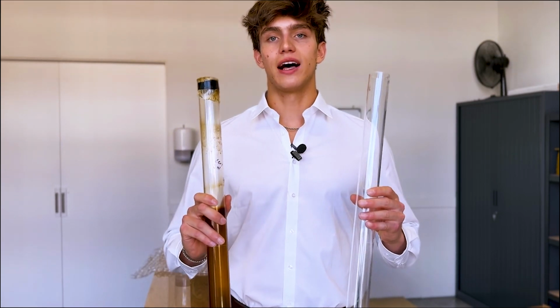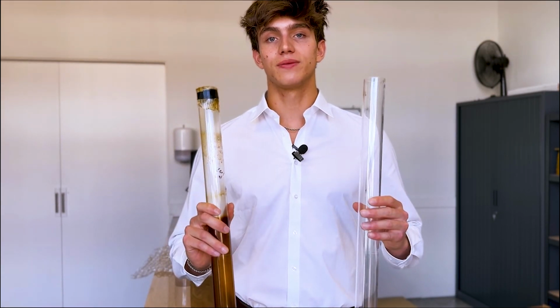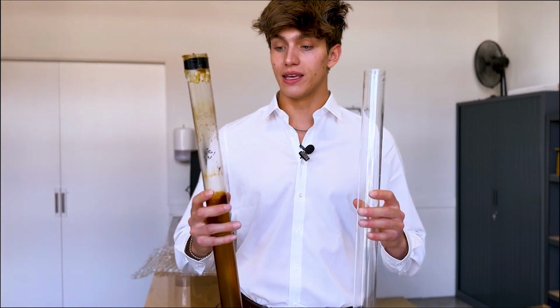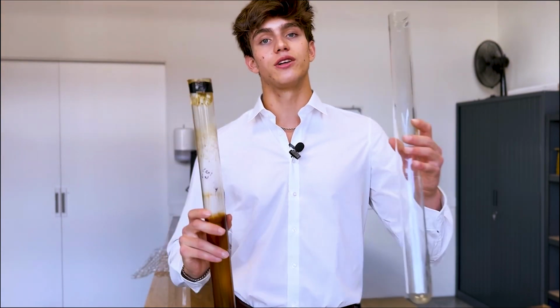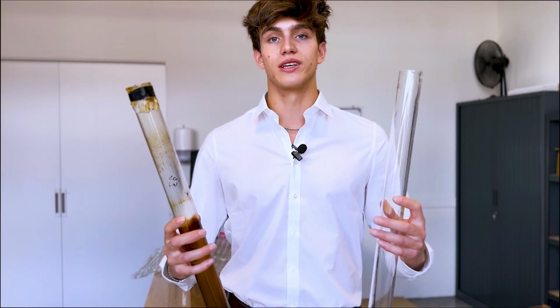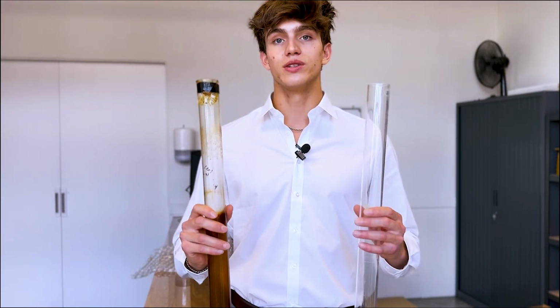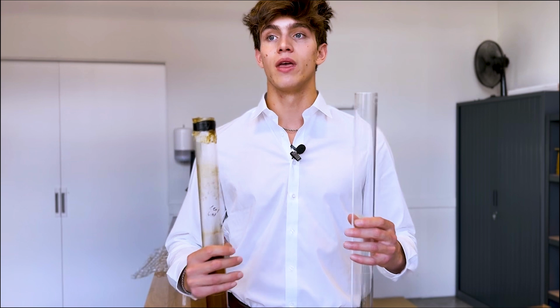These are two pieces of glassware that have been used for the TOPP test. As of right now, the condition of this glassware is assessed subjectively. So people will look at the glassware and say, visually, this is a lot dirtier than this, so therefore it's in worse condition. Now with these two samples specifically, that's not much of a problem. But when you have samples with oil deposits that are very similar in color, it can be very hard to see visually which the better sample was.